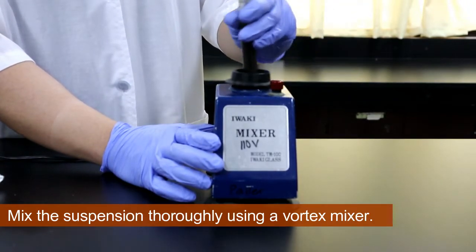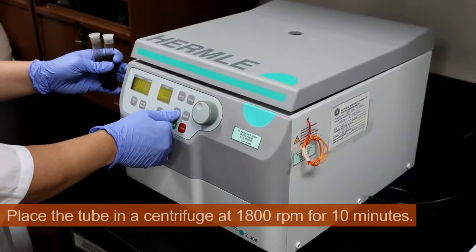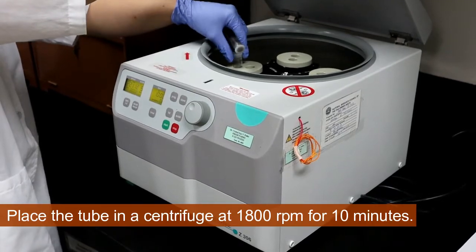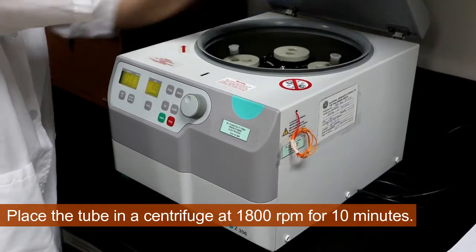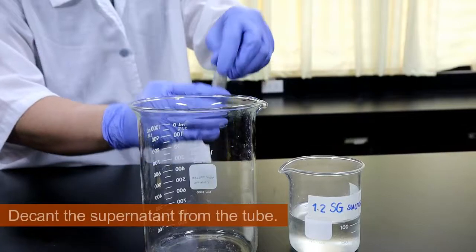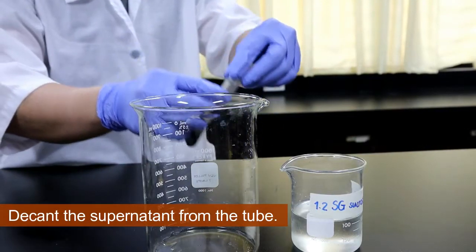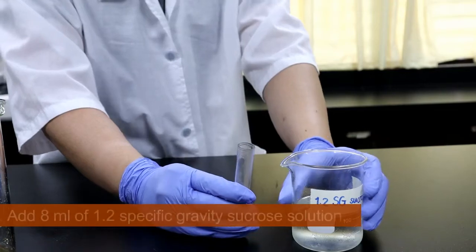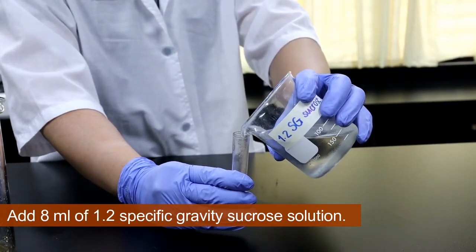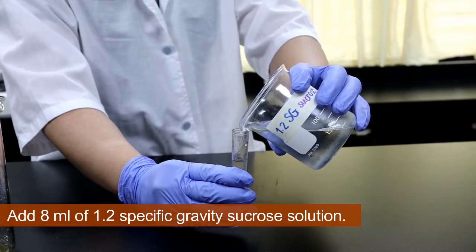After thorough mixing, place the tube in a centrifuge at 1,800 rpm for 10 minutes. After centrifugation, decant the supernatant from the tube and mix the remaining sediment with 8 ml of 1.2 specific gravity Sucrose solution.